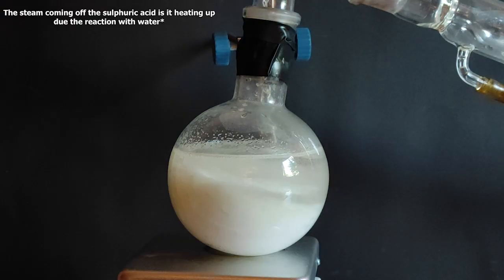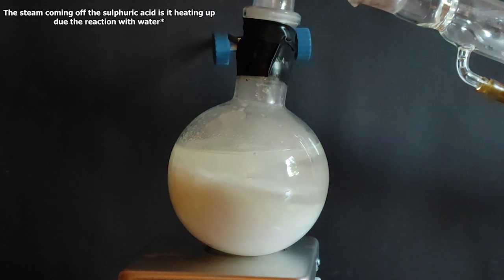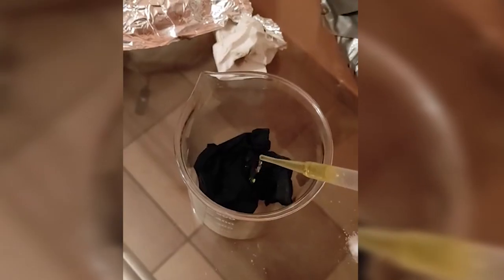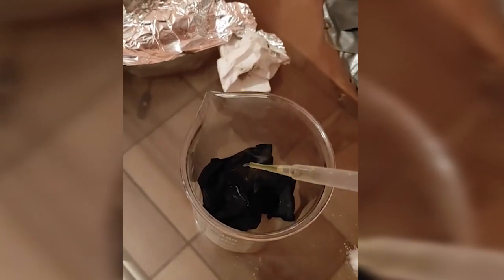I've additionally added 75 ml of water to stop it from becoming too concentrated, but you can skip this step. Remember, without water it will become a fuming nitric acid and you really don't want to use gloves when near it.